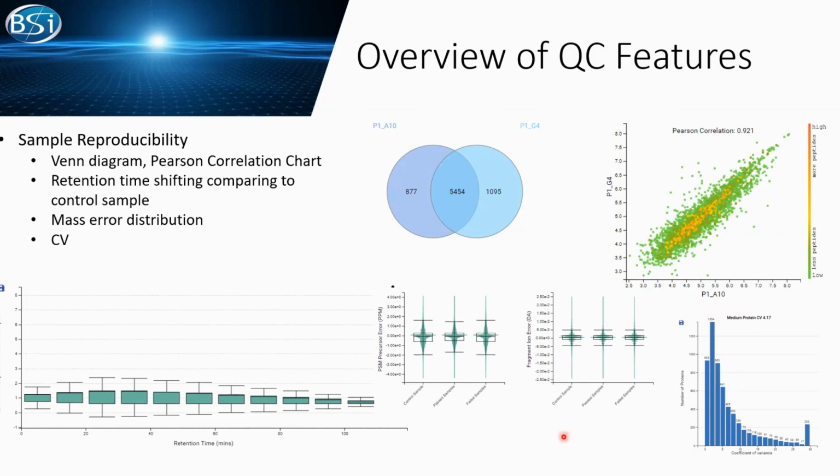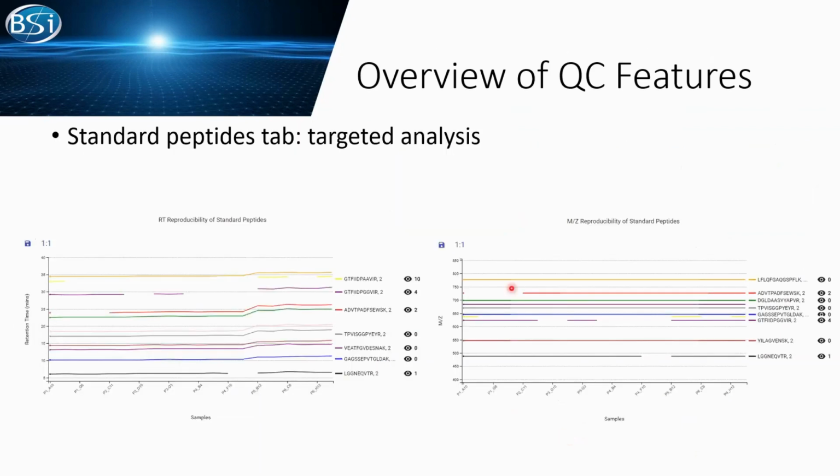So we talked about this data. They're all more general, not really targeted. We can also do targeted analysis in the QC feature of PEAKS Online. So we can take a look at that. For targeted, which is also the standard peptides that you choose to watch, we give out a comparison chart, reproducibility chart here. So you can see the retention time shifting of your standard peptide, the mass-to-charge ratio shifting in your standard peptides.